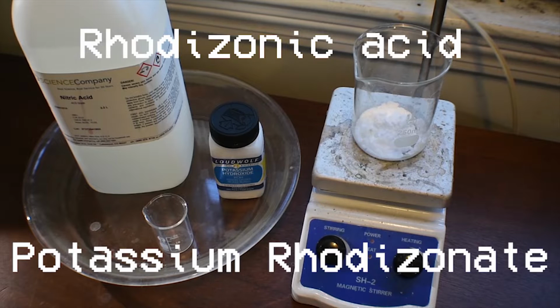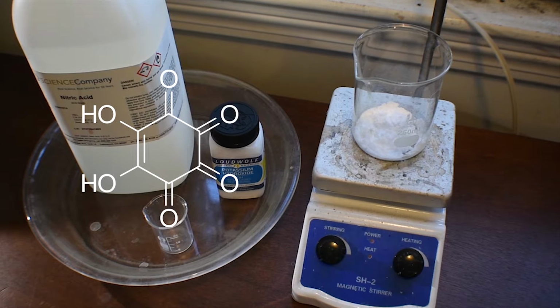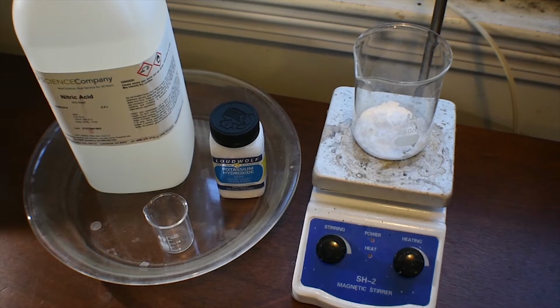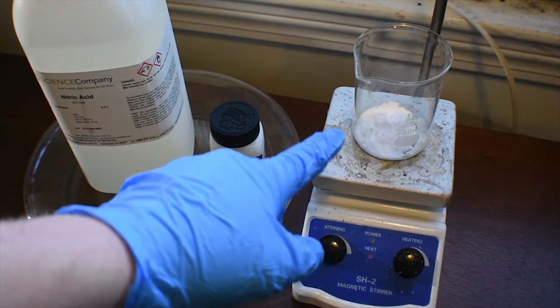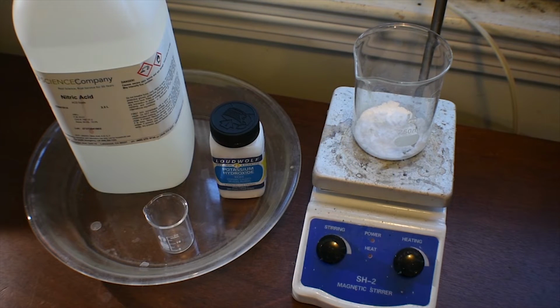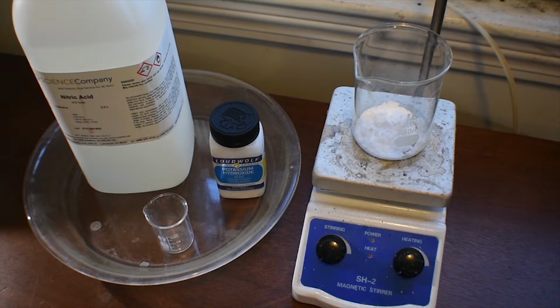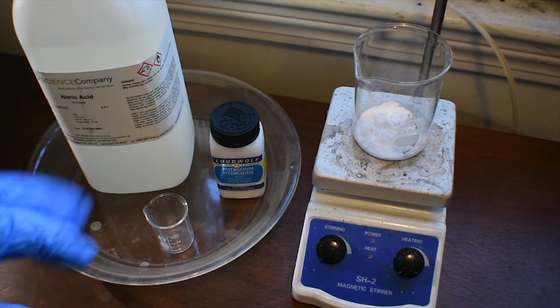Now, rhodizonic acid is an organic compound and it is a sort of derivative of inositol, and kinda not really. Rhodizonic acid is formed from the oxidation of inositol, or hexahydroxycyclohexane, with nitric acid. Here I'm just using 70% nitric acid. You could use higher. I doubt you could use lower concentration, but you just have to adjust the amount.